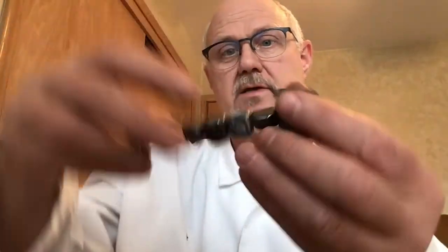All right. One more thing. This one also has some special properties. And I haven't been testing that all the way along, but I should. Look at that. It is magnetic. This one has property that it must have some iron in it, because we know that iron is magnetic. All right. 2 left. Number 12.